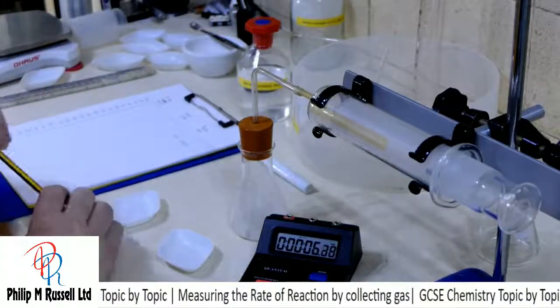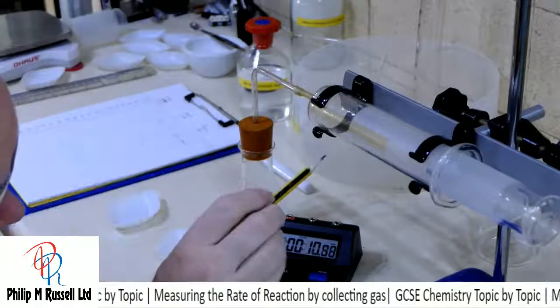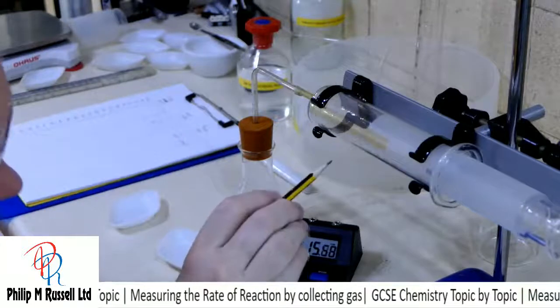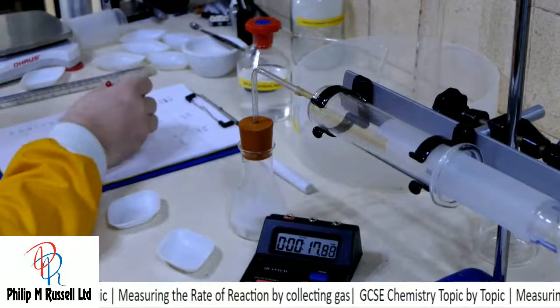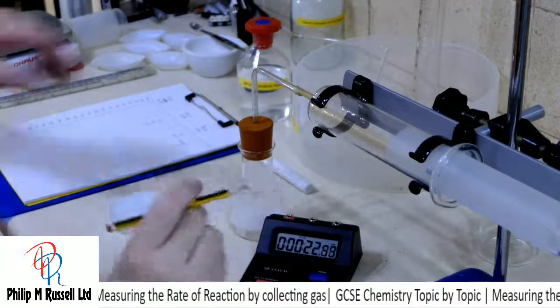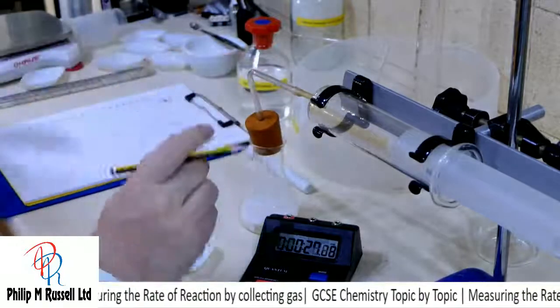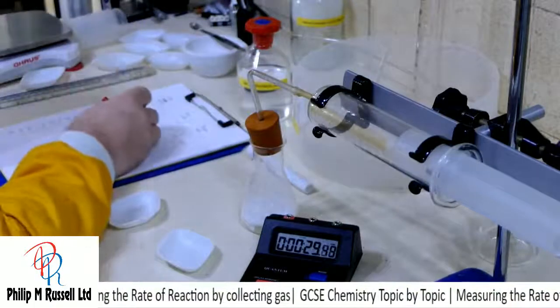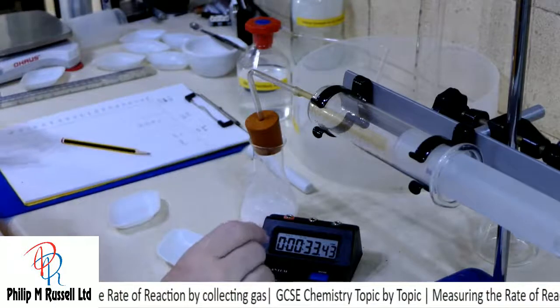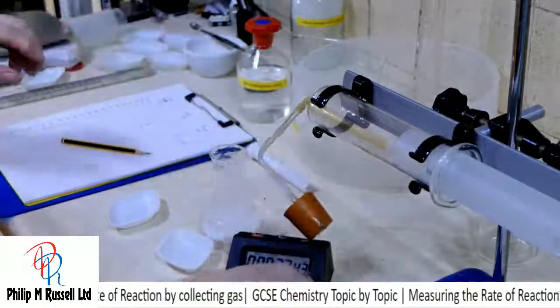5, we've got 23. 10, I've got 51. 15, I've got 73. 20, I've got 95. And that is that experiment over. It really was quite quick trying to do that.